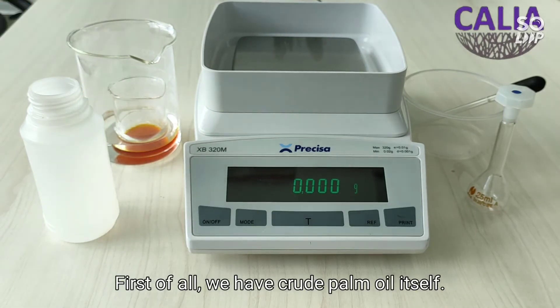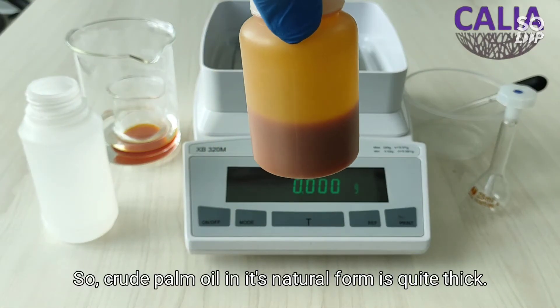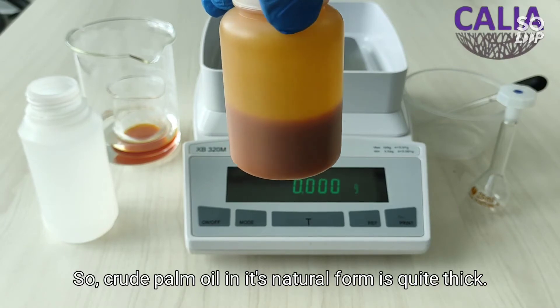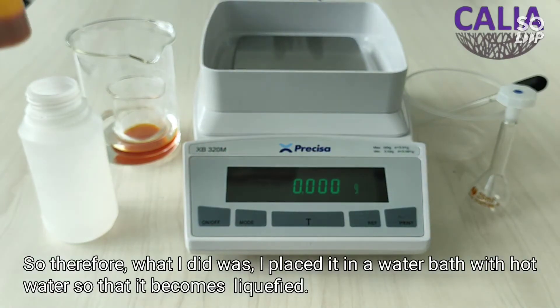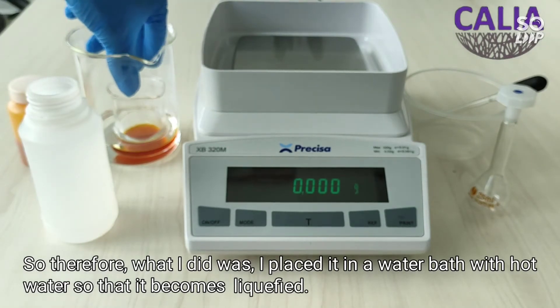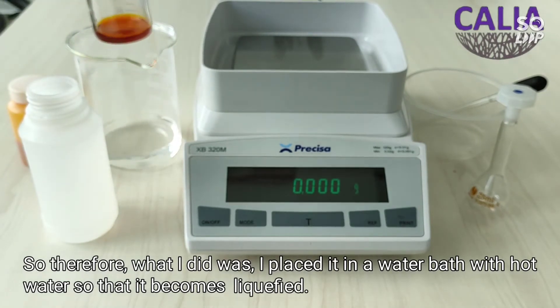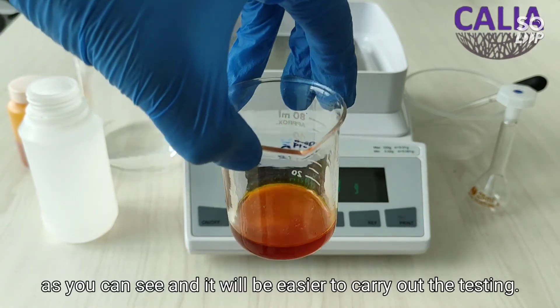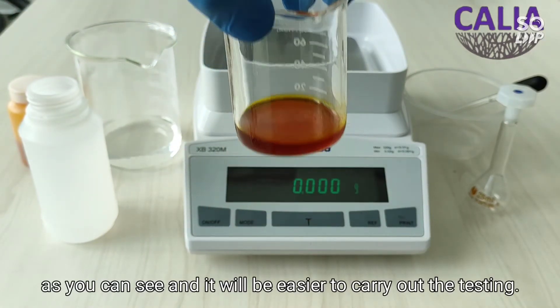First of all we have crude palm oil itself. Crude palm oil in its natural form is quite thick, so therefore what I did was I placed it in a water bath with hot water so that it becomes liquefied, as you can see, and it will be easier to carry out the testing.